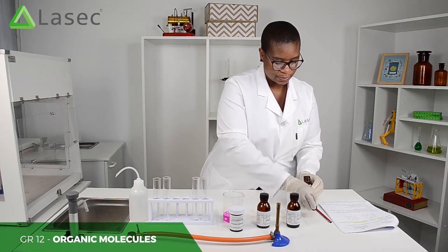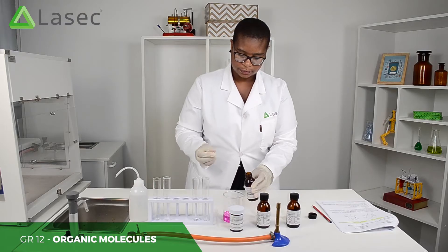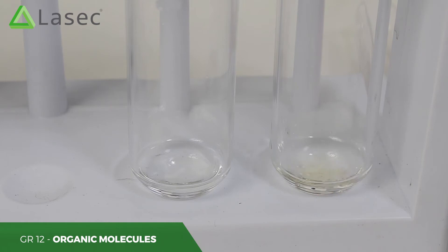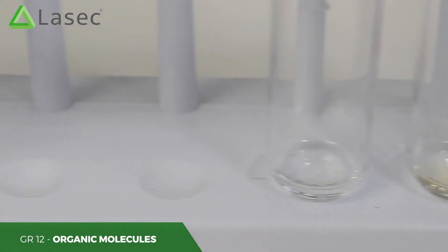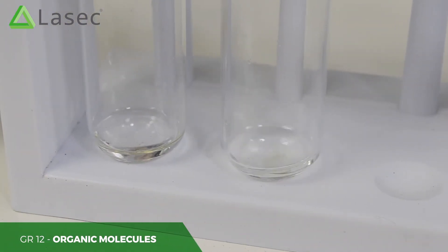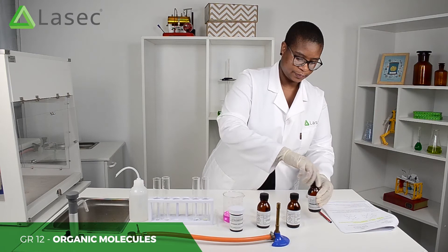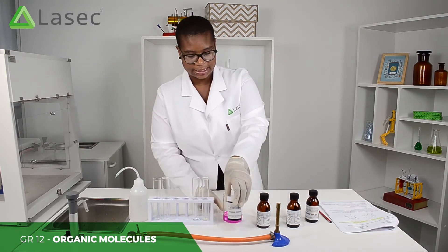We're going to add bromine water to one of each pair of test tubes. To the other test tubes we add potassium permanganate.